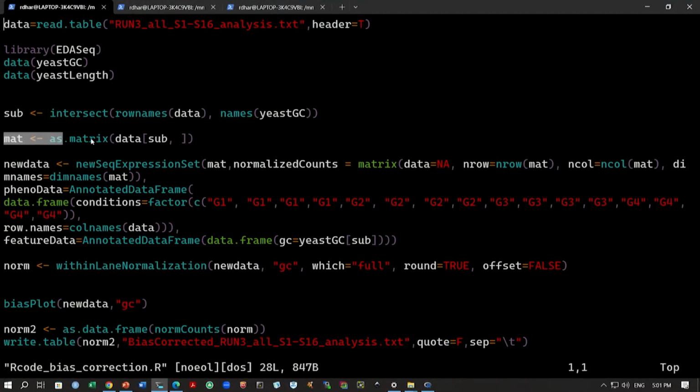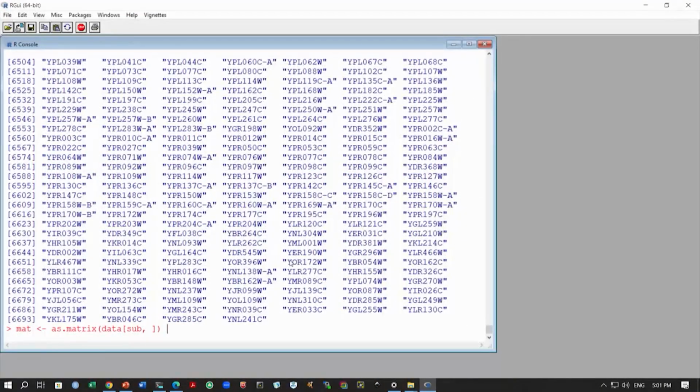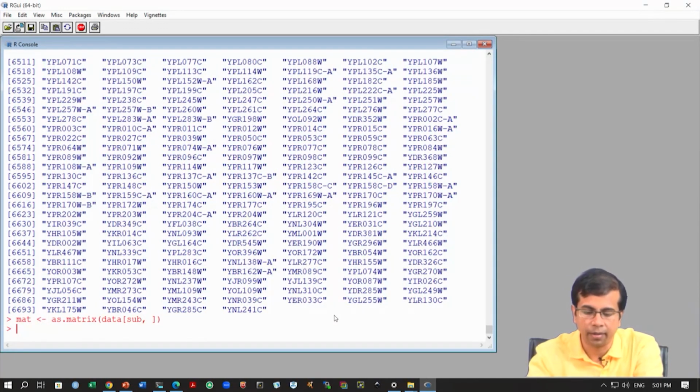Now, what we are doing is creating this matrix taking only these genes. So this sub is the list of genes, and we want only these genes and their count data for the bias correction. We are taking a subset of the data, converting this into a matrix and storing it in this mat variable. So mat will have this data now.